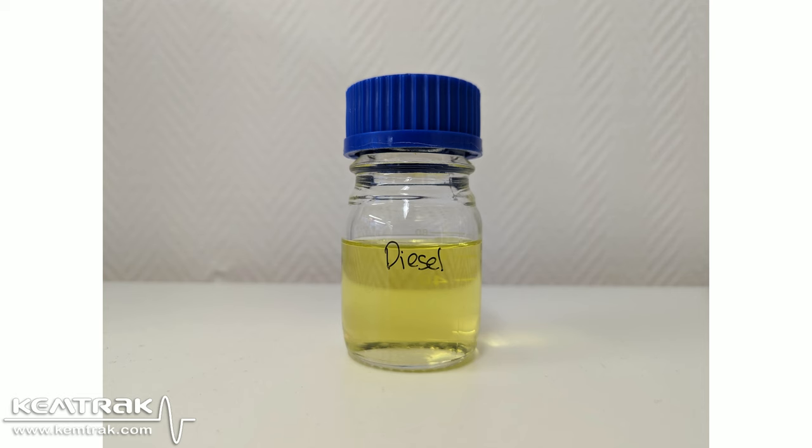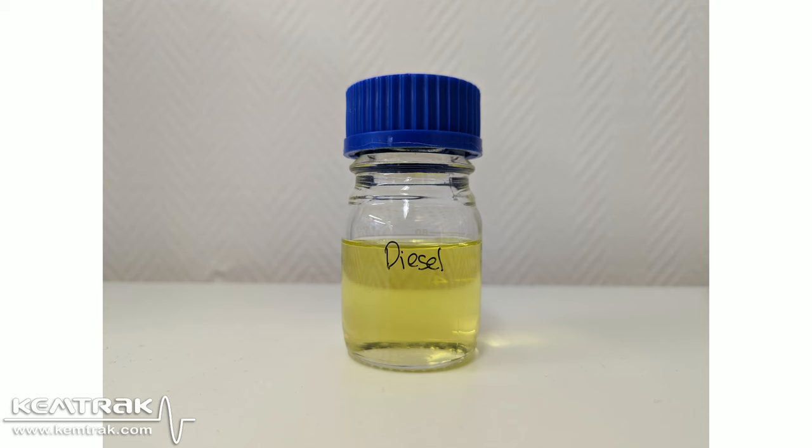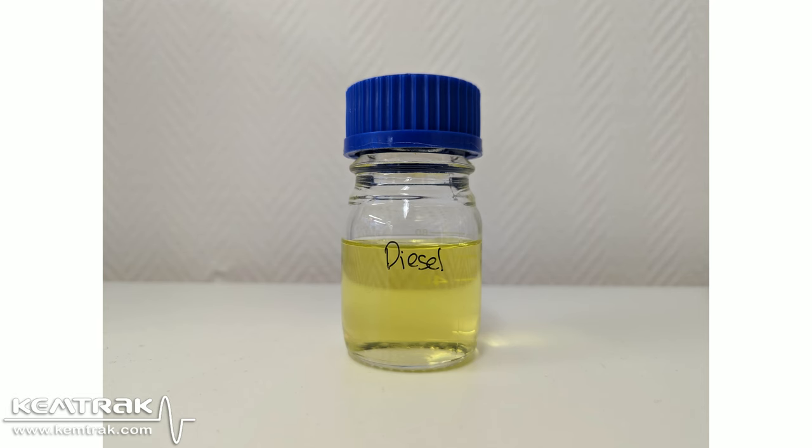Why did the tonic water turn blue? Because it also contains quinine, an aromatic molecule that will emit blue light after excitation by UV light. In the same way, mineral oils rich in aromatic content will also fluoresce when illuminated with UV light.